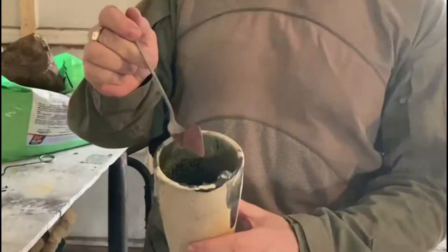I did make a quick mistake. When I put those 50 grams of ore in here, of course that wasn't roasted. So I quickly roasted that and I put it back in now. It's a nice red color and it's roasted. If I hadn't have done that, any gold that was in there would not have been released because the sulfides would have prevented it from releasing.